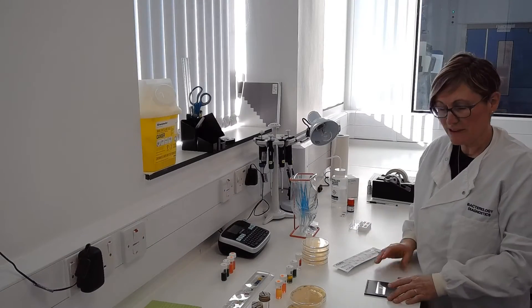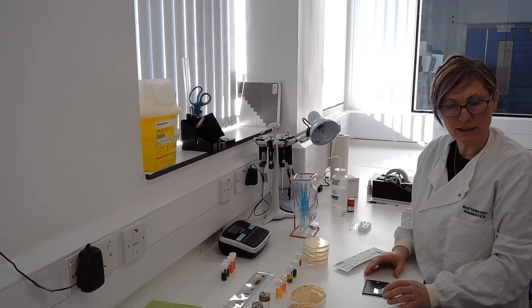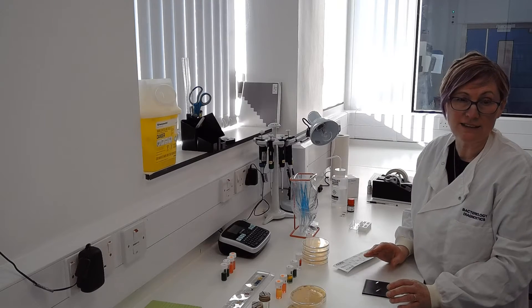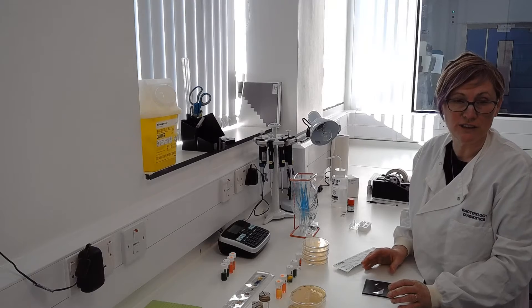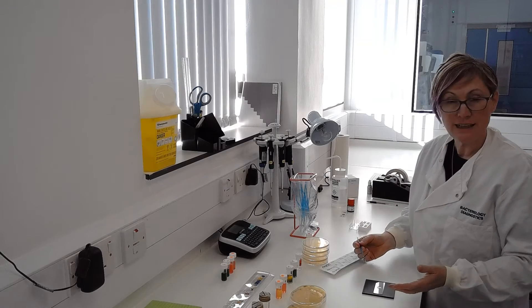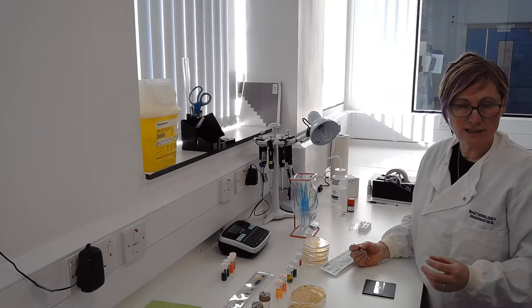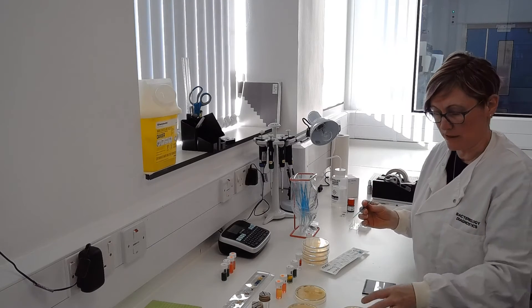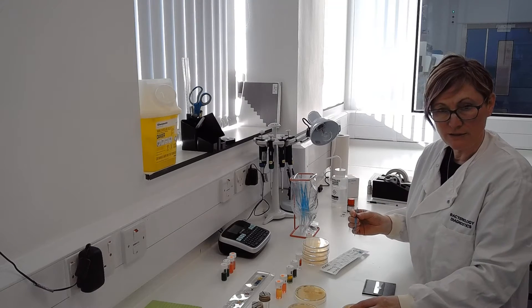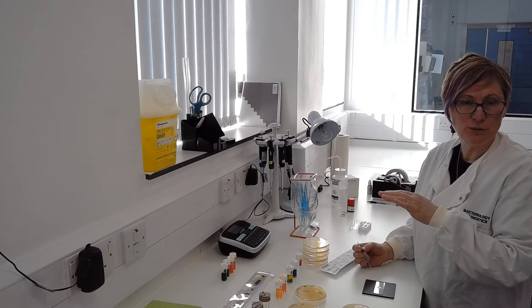The last couple of tests that we like to do as a front line for identification are to put a little bit of my bacteria under the microscope and have a look at it directly, and also to stain its cell wall to see what properties the cell wall has and have a proper look at the structure of each individual cell. We do this by making a small suspension of the bacteria in saline, which is a salt solution designed to make sure the cell stays in optimum condition — it doesn't collapse or expand because of the amount of water present. I take another small amount of my individual colony and mix it into the saline. The stained one will be allowed to dry and then stained with four different chemicals.